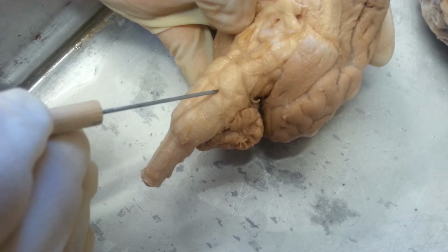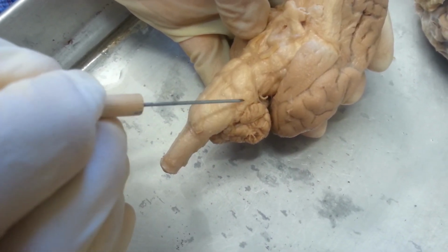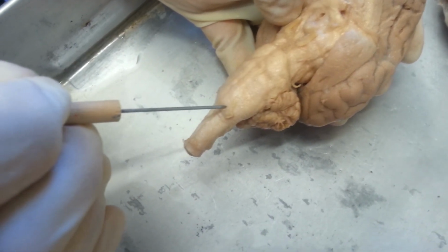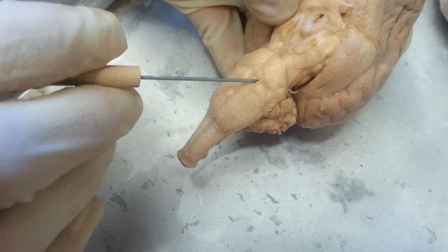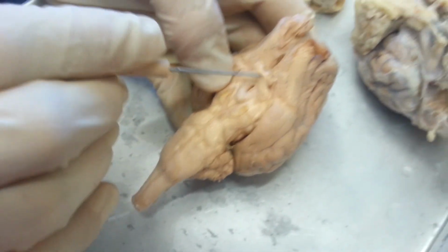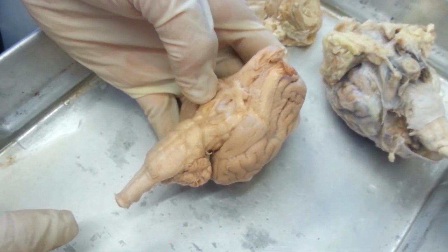Okay, 6. Then you have 7, 8, 9, 10, 11 all right there, and they go in order, but you just can't see them on this one. And 12 is also in the middle. So 3, 6, and 12 are all in the middle. The rest are on the side, except for 1 and 2. That's all.